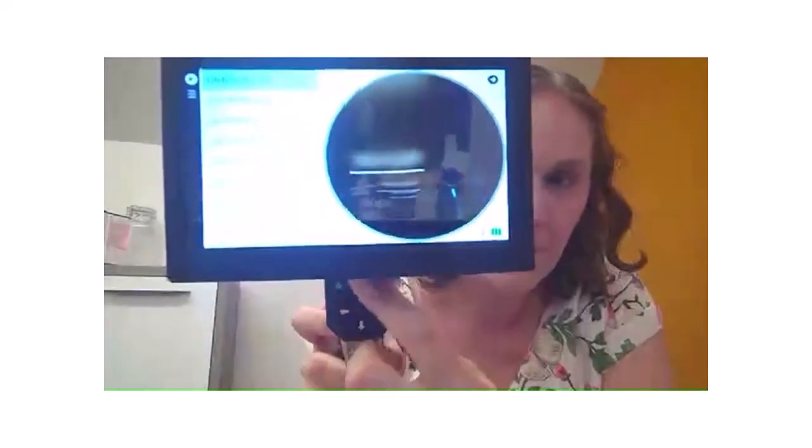Wendy? Sometimes the unit hangs during startup with a black screen. I can actually answer that. This is Susie, Wendy. The reason that we put the blue power light on is just for that reason. There is a little computer on the instrument, so it takes a moment as it's starting up before you will see the CID Bioscience logo. Once you press the power button, as long as you see the blue light, know that the computer is starting up, and within, I'd say, 30 seconds or so, you'll see the CID Bioscience name and then the menu starting to come up.